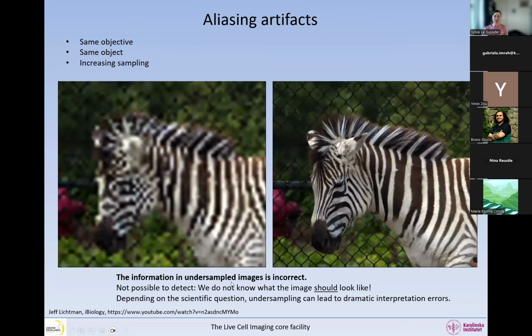The information in undersampled images is incorrect, okay? And it's not possible to detect because we do not know what the image should look like. So depending on the scientific question, undersampling can lead to dramatic interpretation errors. You can see this image: if the idea is that we count how many zebras are in this image, no problem. If the idea is that we study the shape of the pattern on their back, we're in trouble, okay? So as always, the way we set the microscope and everything is fully dependent on the scientific question.